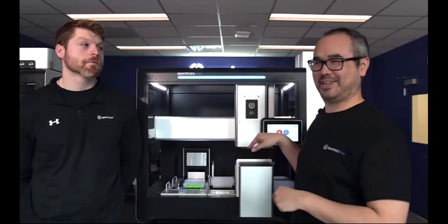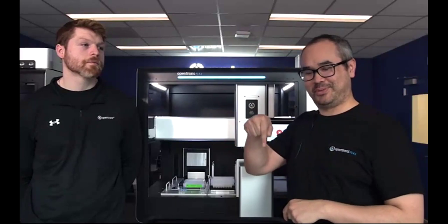There is a 3D printed STL file for an adapter that could put a nanopore on the robot itself, and I have done a small protocol trick with a single channel to load the nanopore MinION on the robot. So yes, we have worked on nanopore protocols.